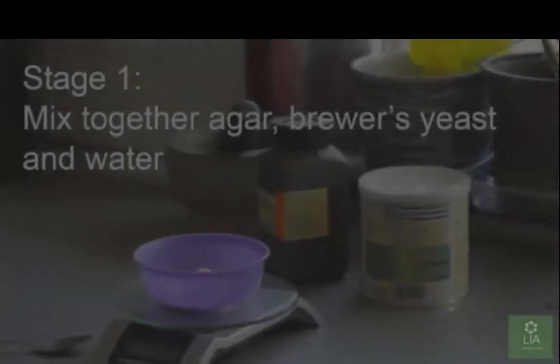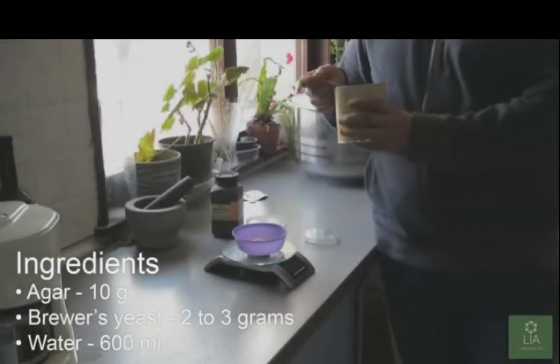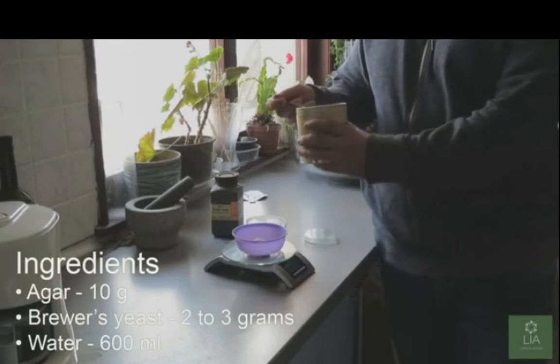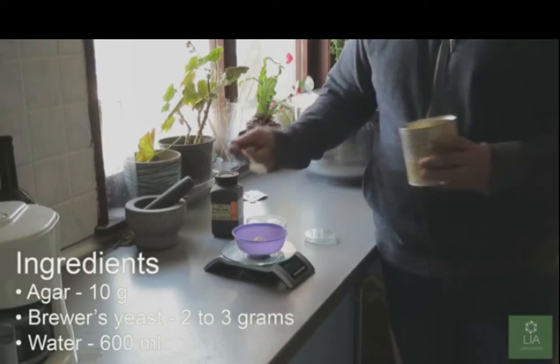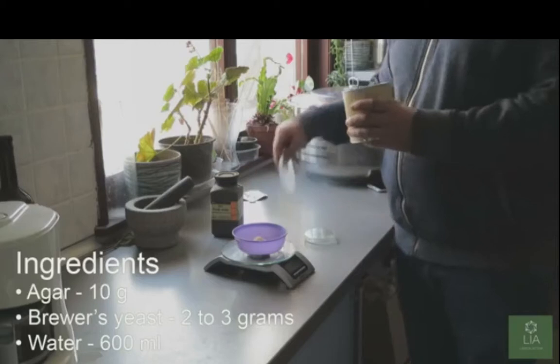Let's just see what's going on here. I'm not actually using this procedure, these chemicals. I'm not even using brewer's yeast.